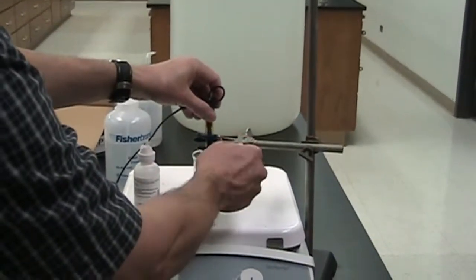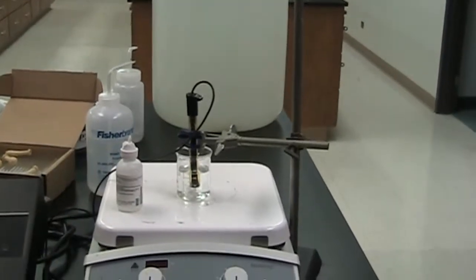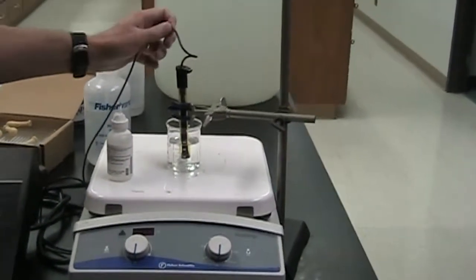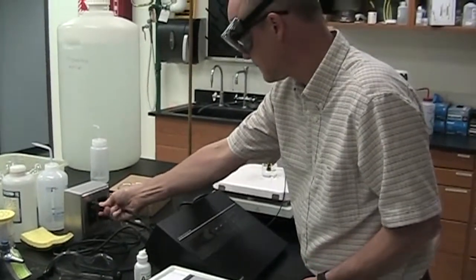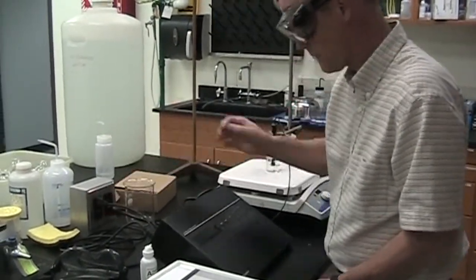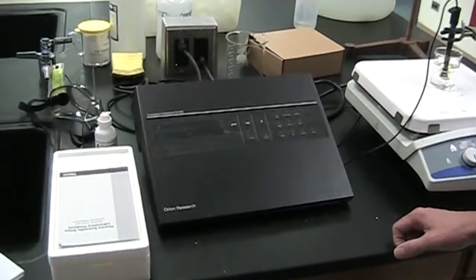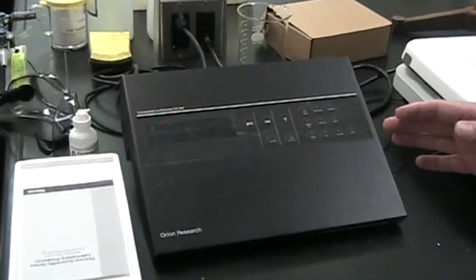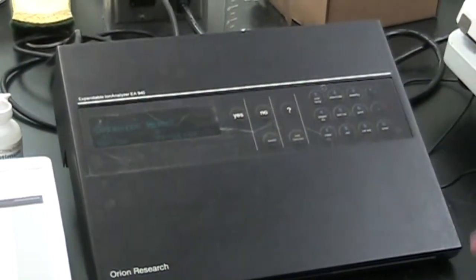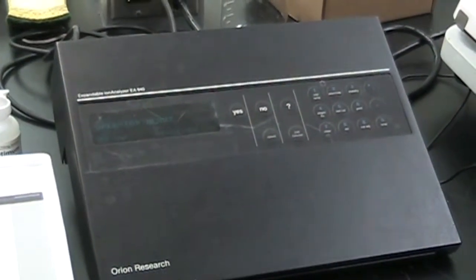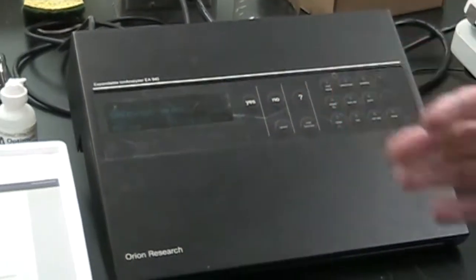It's usually pretty convenient to have the electrode held in place. It's good to stir the sample so we have it set up on the stir bar. We're going to plug the meter in, and the screen lights up. We're going to simply go to a page that gives millivolt readings. It says operator menu and some other gibberish. It thinks it's January 1st of 2000 or 1900.